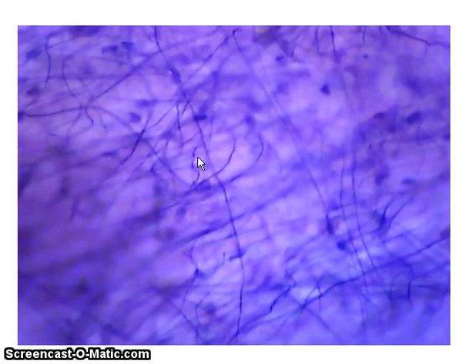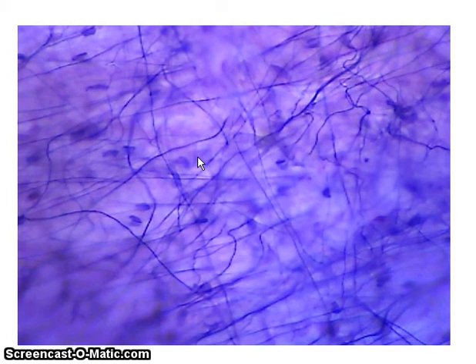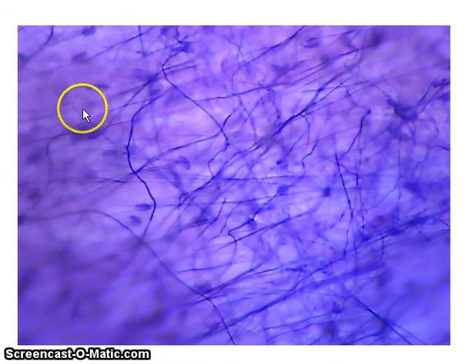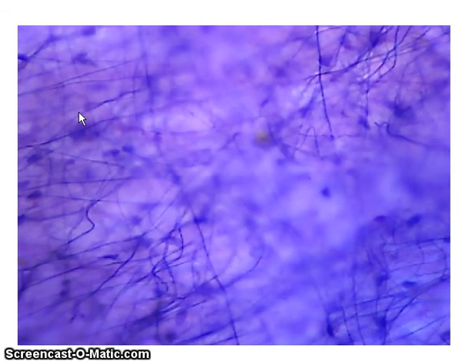Next, we have our thick collagen fibers. And the thick collagen fibers, remember, these are the fibers that are unbranching, they're not wavy, and they're a little bit thicker than the elastic fibers. So here's a collagen fiber right here. These are our thick fibers. The thinner fibers, like right here, these are the elastic fibers. And so again, if I tweak my fine adjustment back and forth, I can see some thinner fibers and thicker fibers popping out.